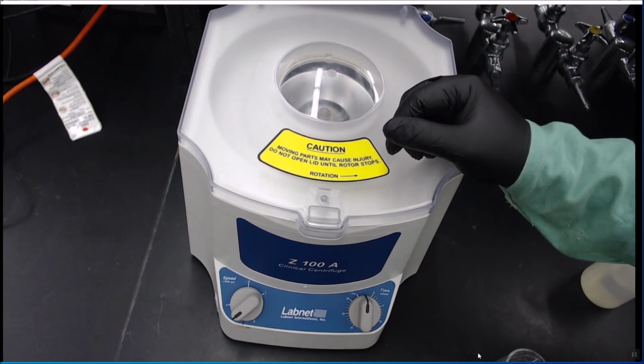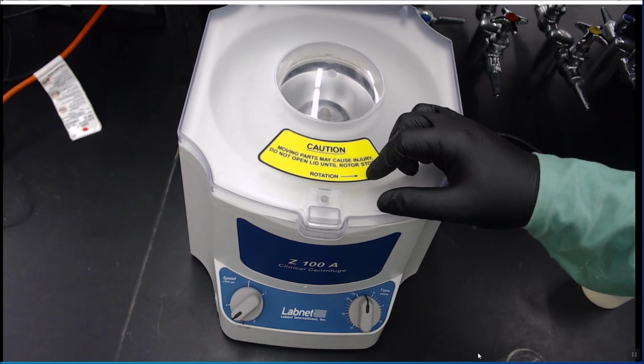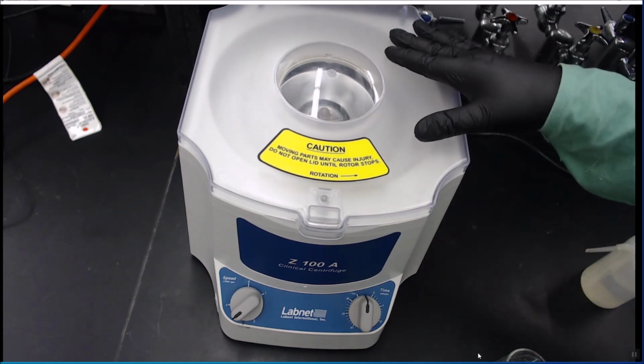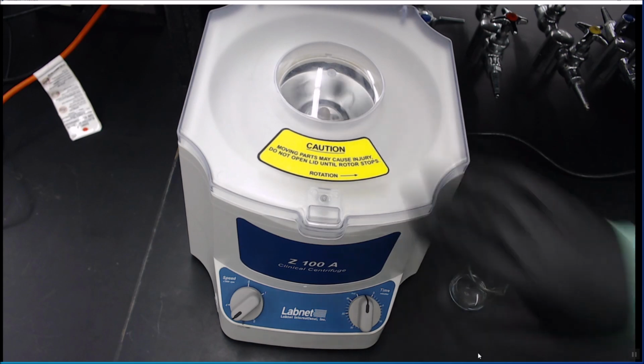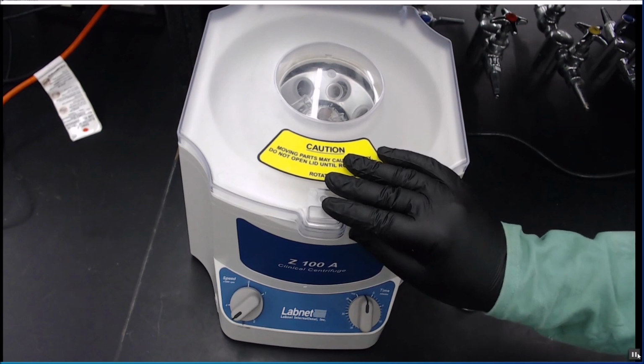Alright, so we did our 2-minute run. We are going to wait for it to come to a complete and safe stop. And in the meantime, you can start pulling up your Excel, because once we drain this and pop it in the oven, that's where we're going to go next. So I will see you in Excel.